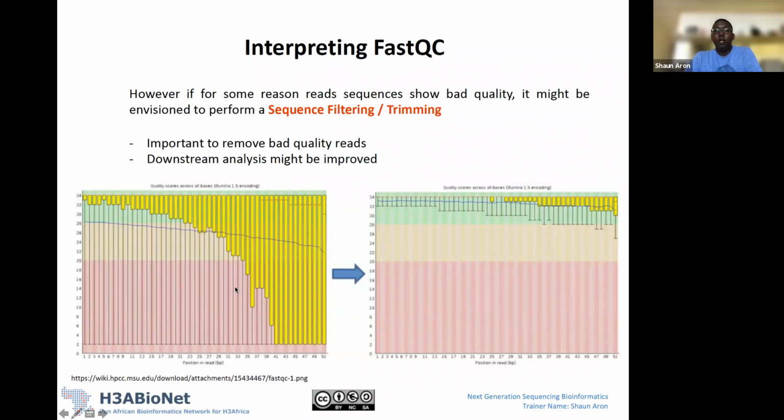Okay. So what we can do is use some tool to say, I want to, for example, only keep reads with an average score of above 20 across the entire read. And we might be able to clean up the data whereby we can go from something like this to something like this, which looks pretty good. We will end up losing some of our data, but then we at least are saving the sample, right?